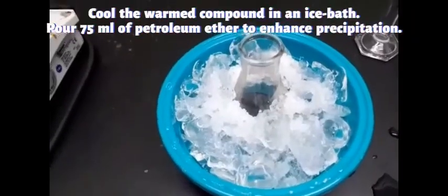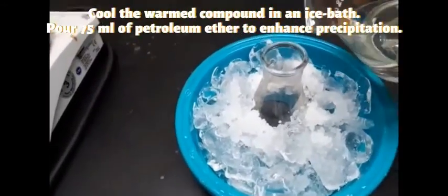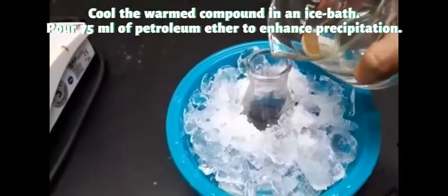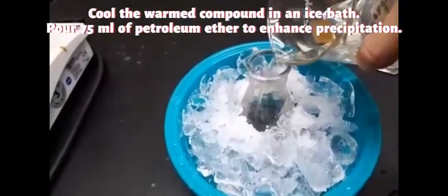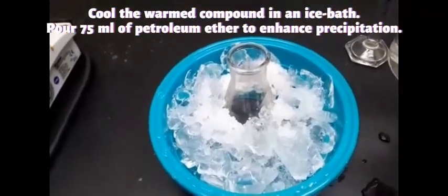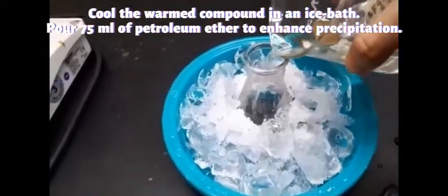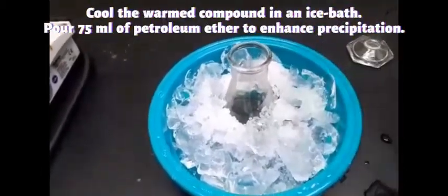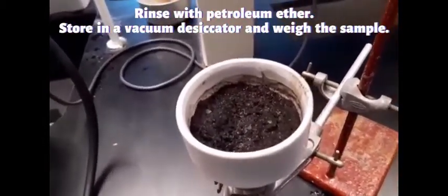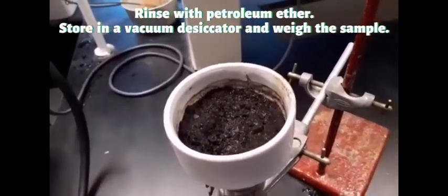But before we proceed to filtration, add around 75 ml of petroleum ether into the cold solution to enhance the precipitation. The purpose of adding petroleum ether is to enhance precipitation. So this is what we got, and don't forget to rinse a bit with petroleum ether and let it dry for a while before we store this in the vacuum desiccator.